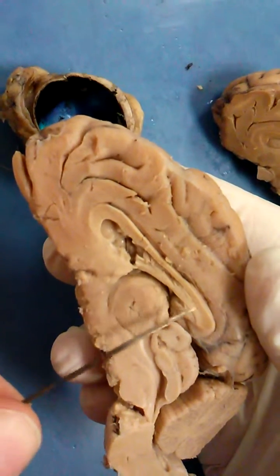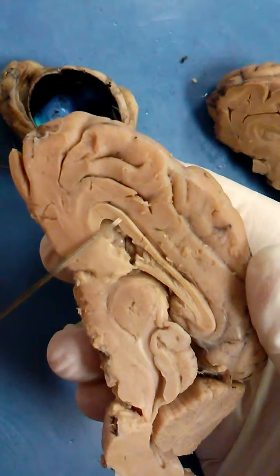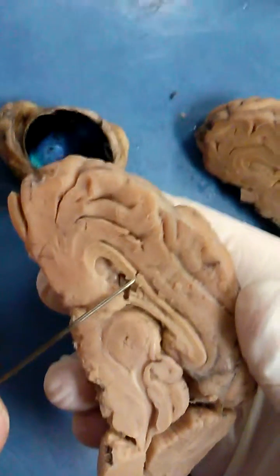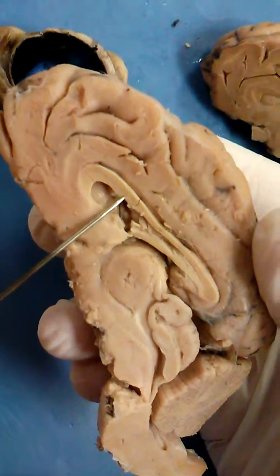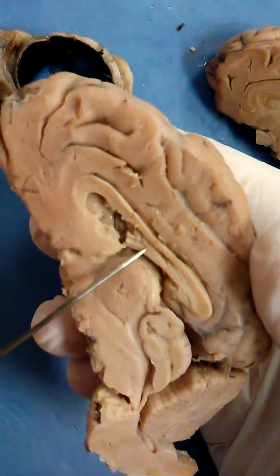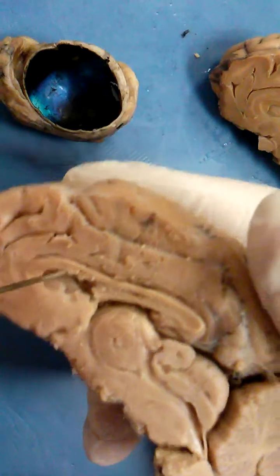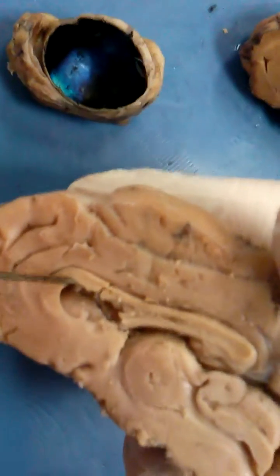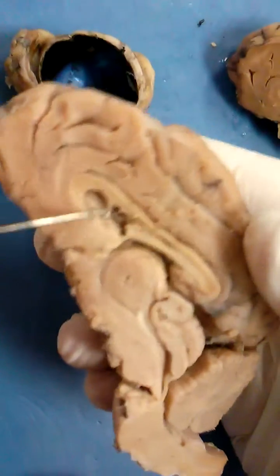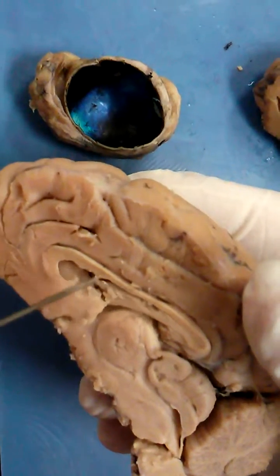This part right here is the corpus callosum — that top layer. The bottom layer is the fornix. This space in here where the needle is pointing is the lateral ventricle. It goes all the way across — that's where the cerebrospinal fluid goes.